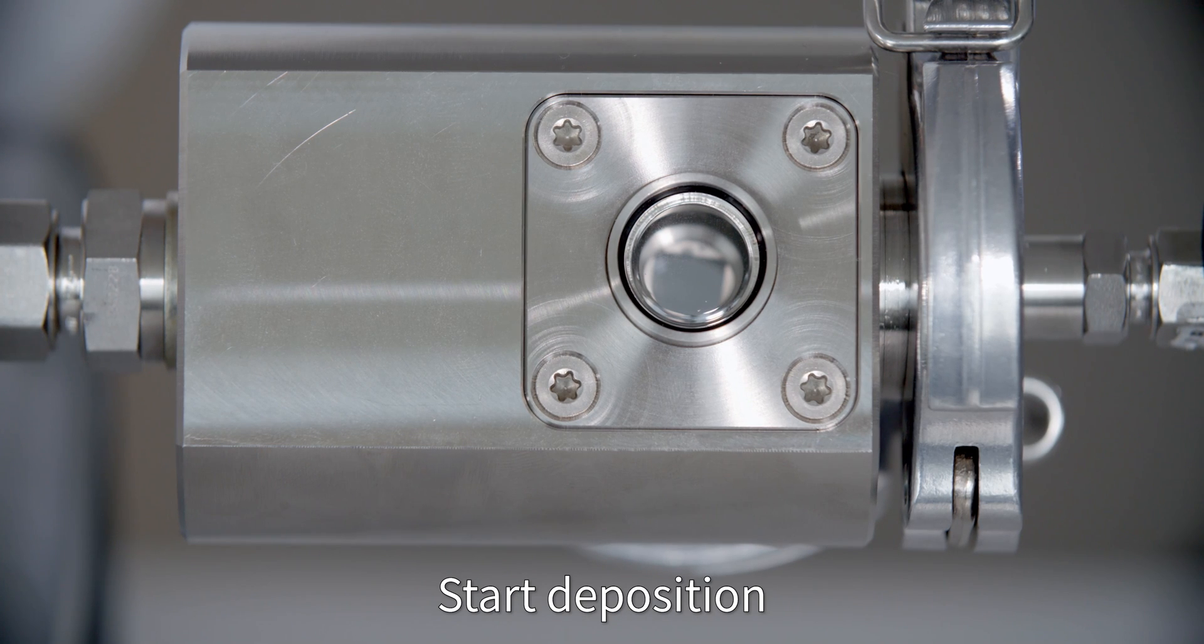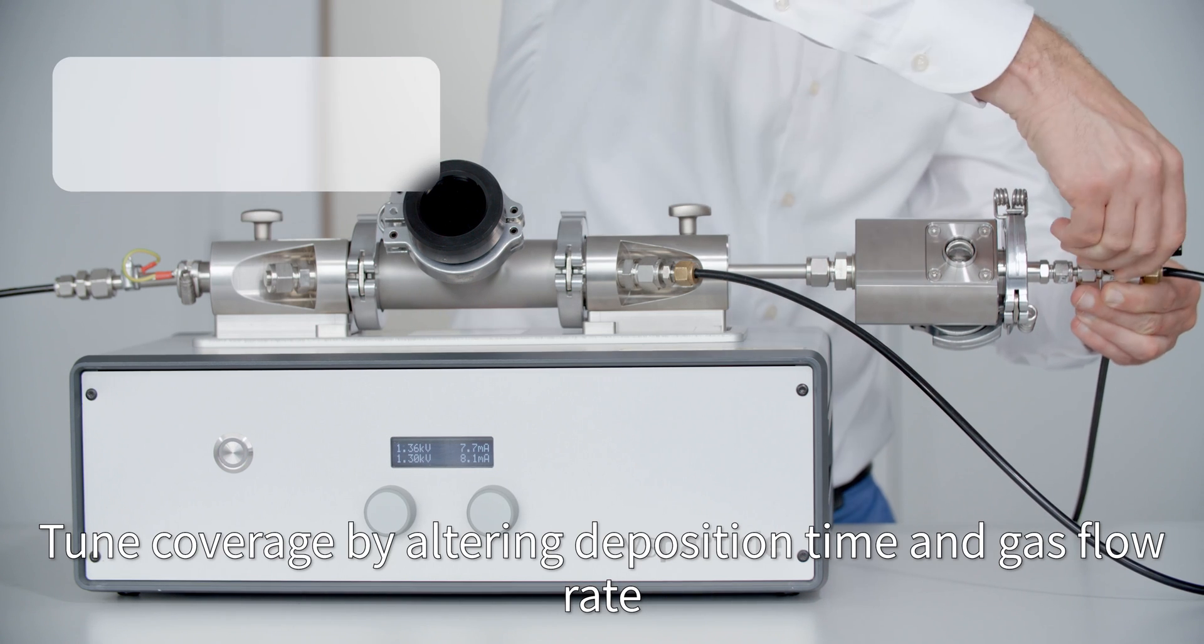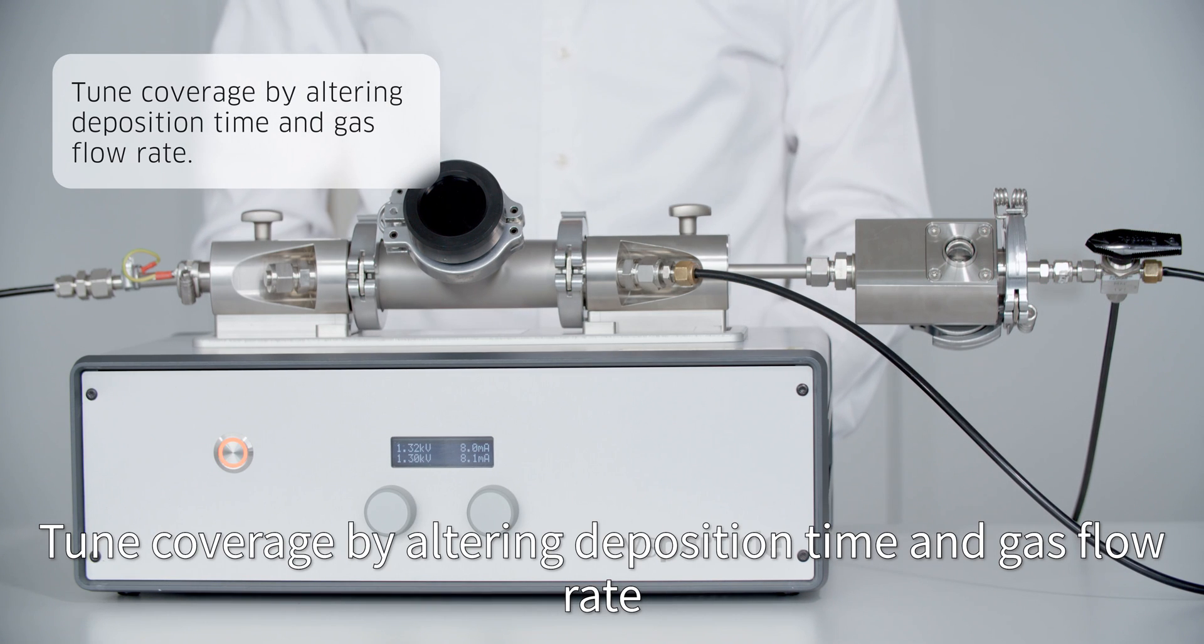Start deposition. Tune coverage by altering deposition time and gas flow rate.